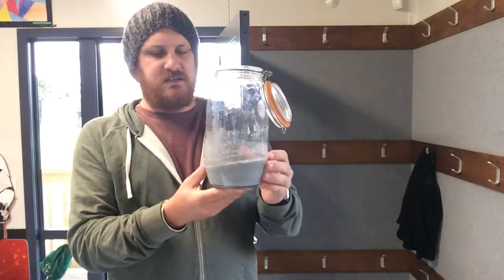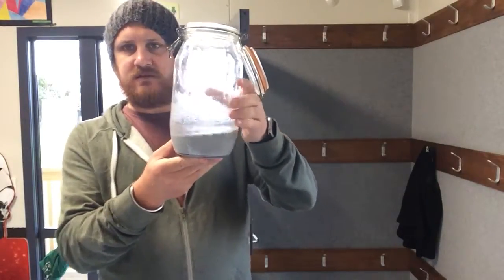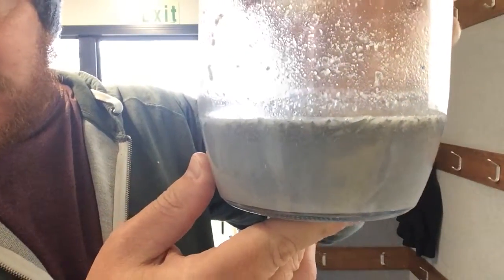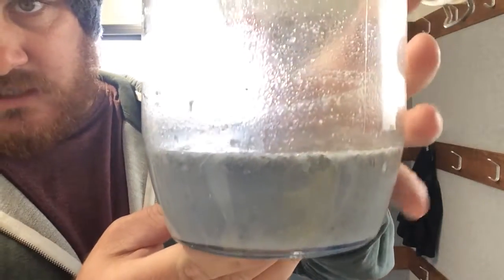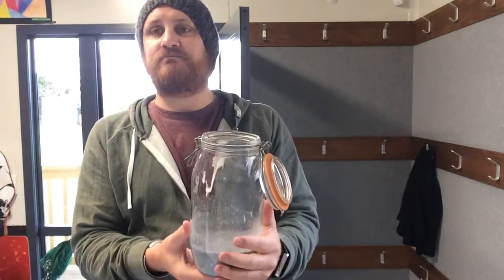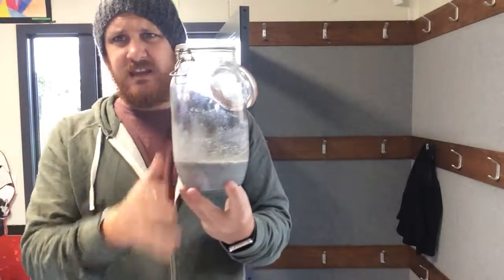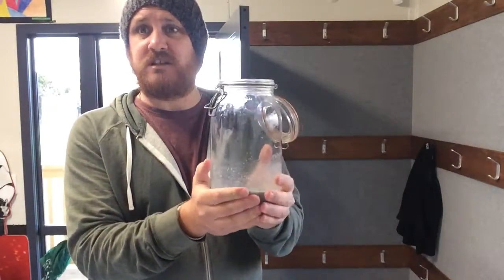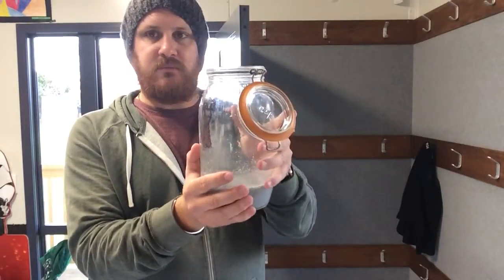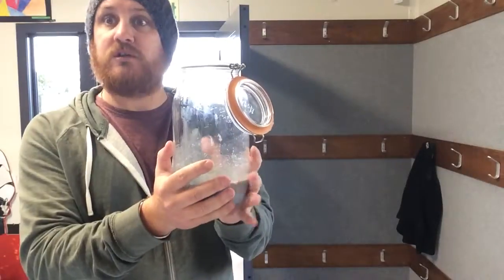So we're back inside again, guys, and the experiment's pretty much over. And basically what's happened is, if I get nice and close here, all of that slurry is the aluminium that's decomposed and been broken down into our acid mix that we made using water and my secret powder X. And so it's exothermic, like the jar is warm to the touch, and that's not my body heat. My hands are colder than what the jar feels at the moment, and by comparison, further up the top of the jar it's quite warm there, and then relatively, I wouldn't say hot, but warmer there.